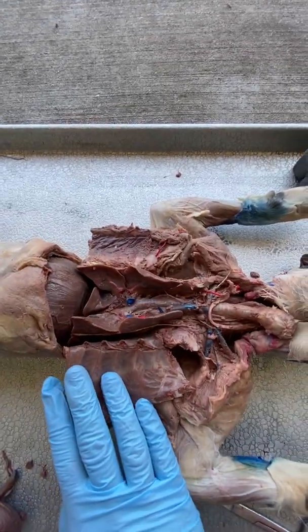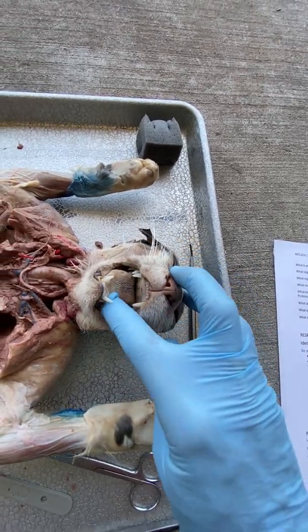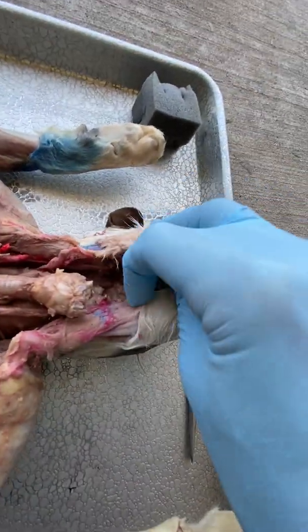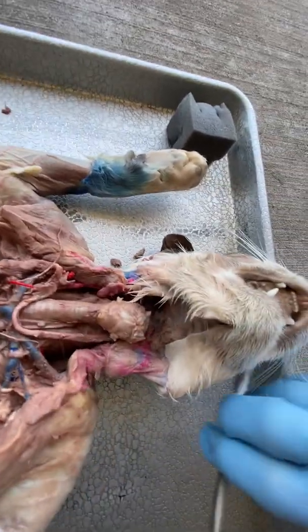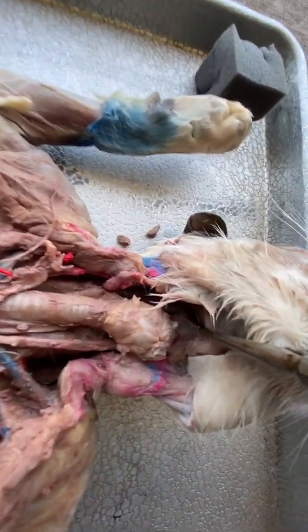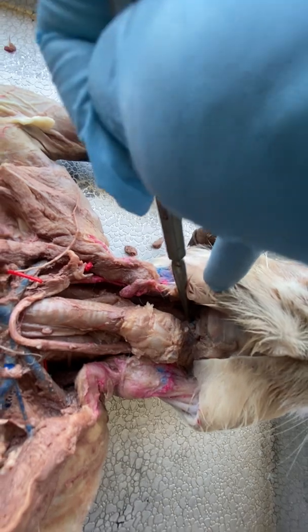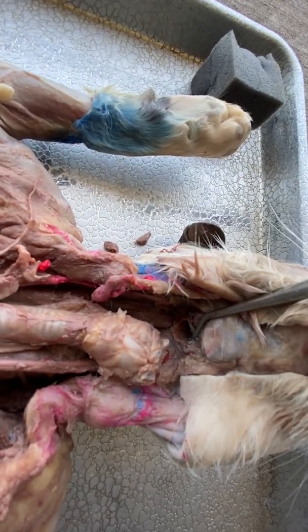First, when we breathe in — we've got our thoracic cavity open — air is going to come in through our external nares or through our mouth into our nasal cavity or our oral cavity. From there it's going to go into our pharynx. If I open this up and take a probe, our pharynx is going to be this hole that goes up into our nasal cavity and oral cavity. It's a little hard to see, but it's just a hole.